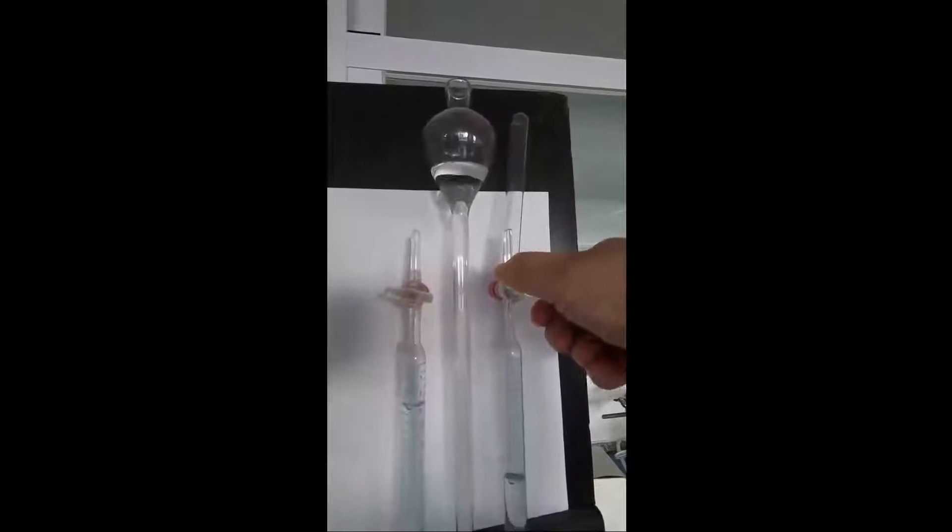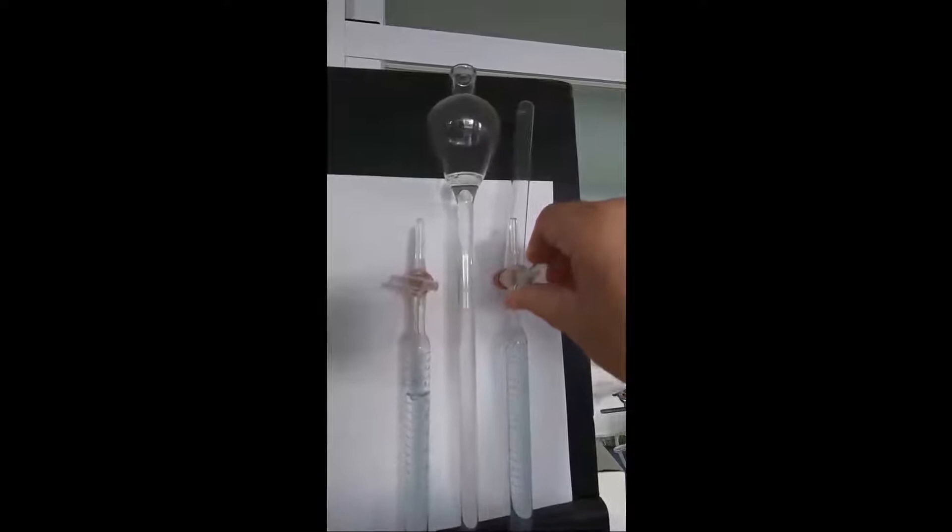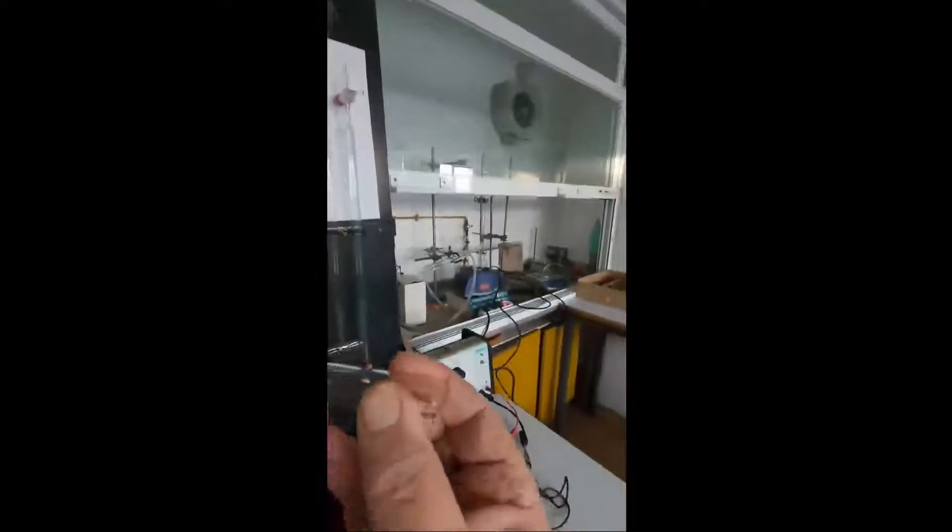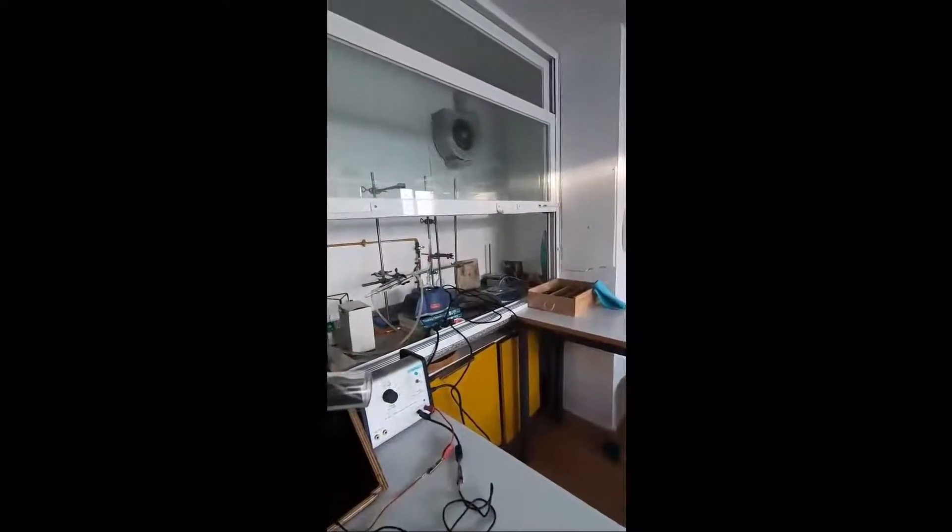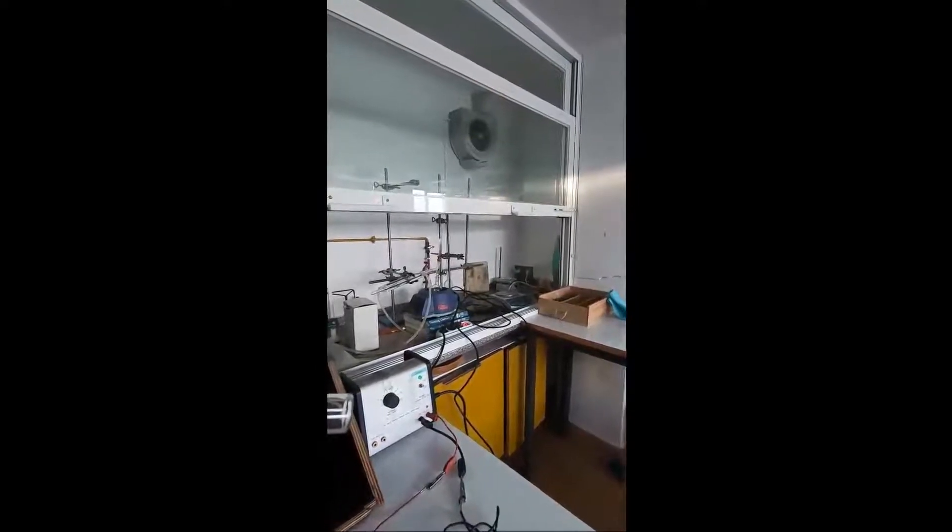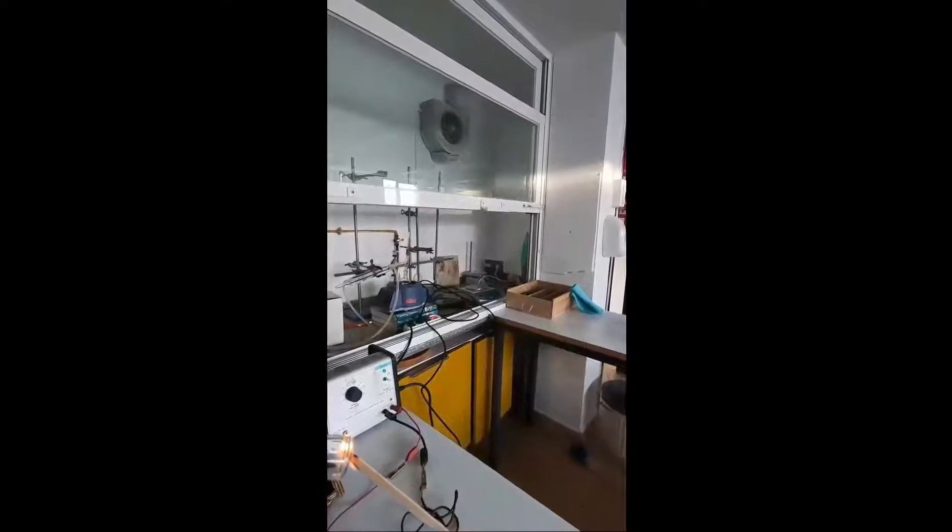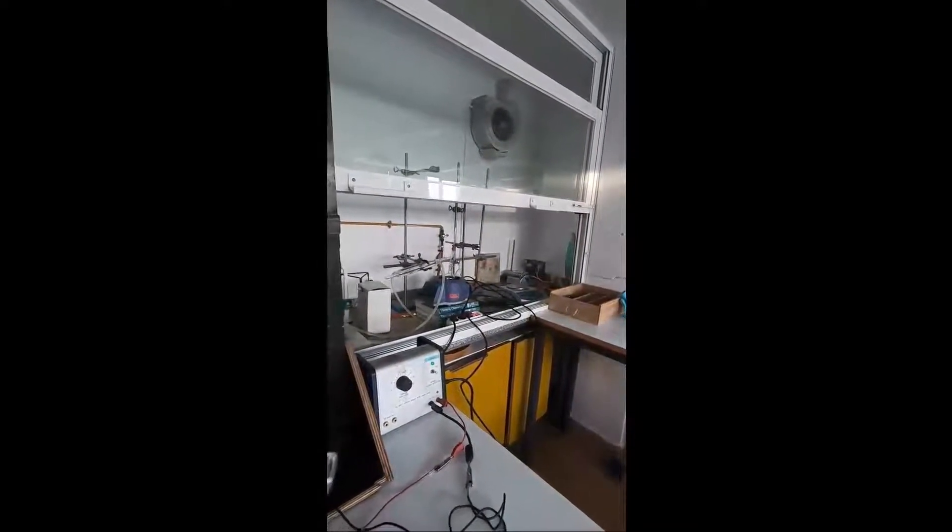First of all, let's just open the tap. As you'll see, the water level will go up as the gas goes up into the tube. We now have a tube of this gas, and we're going to just put a lighted splint near to the end of it and see if we can get a squeaky pop. That gas is hydrogen.